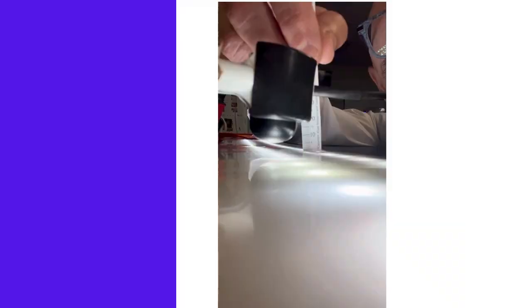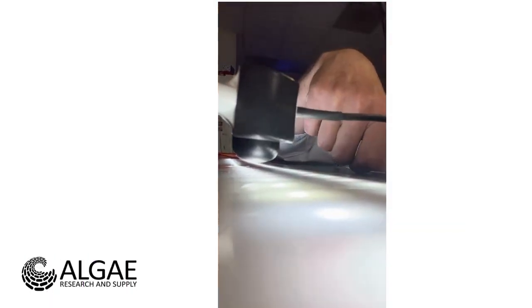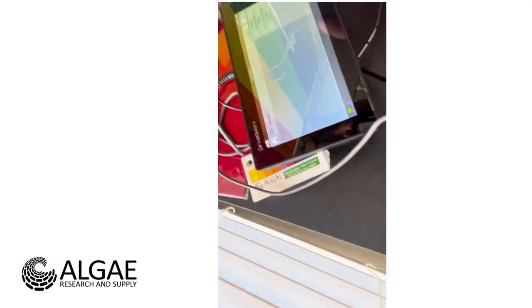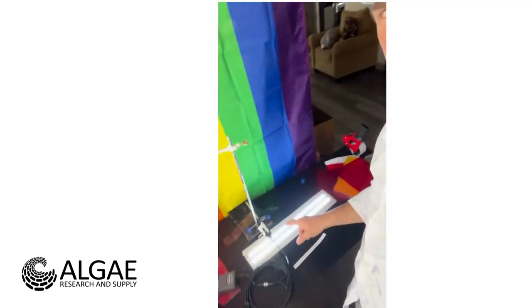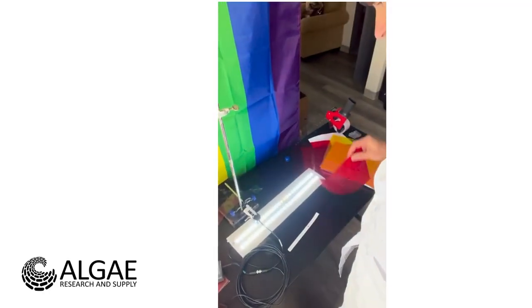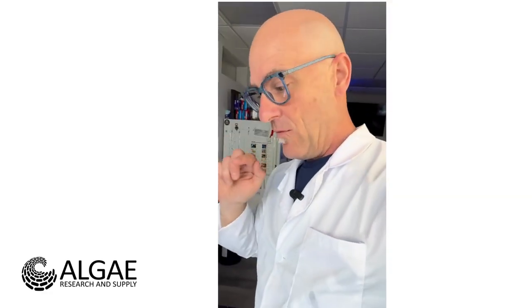It'll be worth it. You'll see. Yep, about 5 millimeters from the bottom. And the intensity of the reading that we're at, oh, it just went away. But that's how we're going to get it, so that we have the same spot, so that when I change the screen here, we can go through all the different screens in a row, and we can get an idea about what the flux of photons into the meter from that one specific LED is going to be.